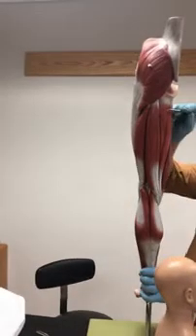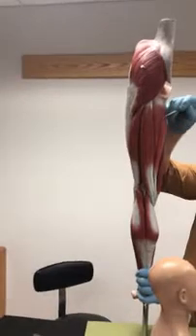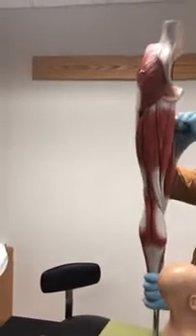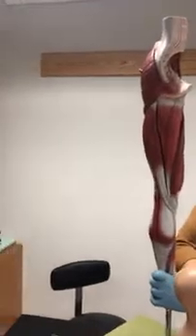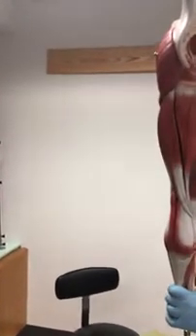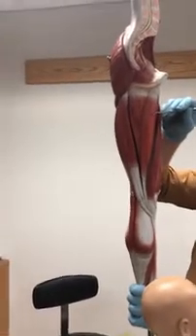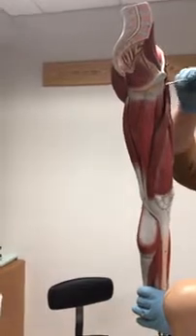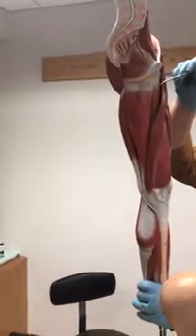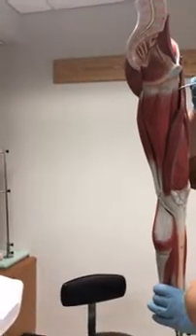What's this muscle here? Yes, that's the adductor magnus or femoris, right next to it. Okay? What's this muscle here? Be careful. No. Wait, where'd you point it? This one here. It's not the gracilis. Yes, that's the gracilis. And then this muscle over here would be the adductor longus. Okay? Well, and then we're back to the sartorius.